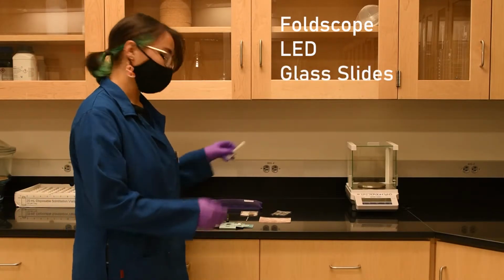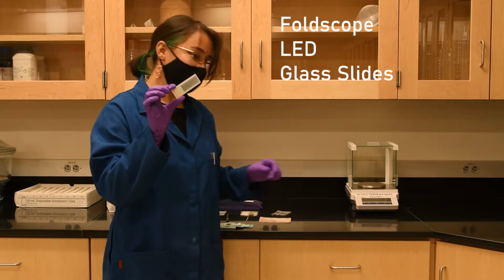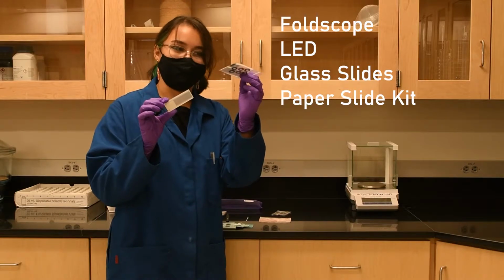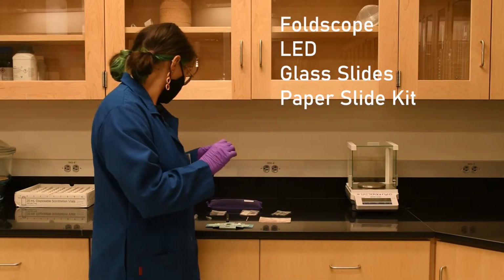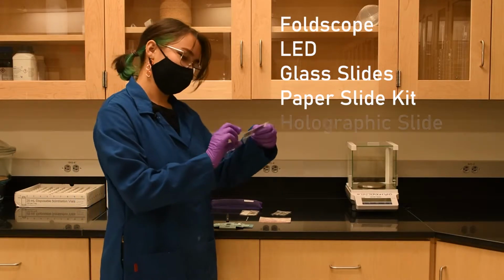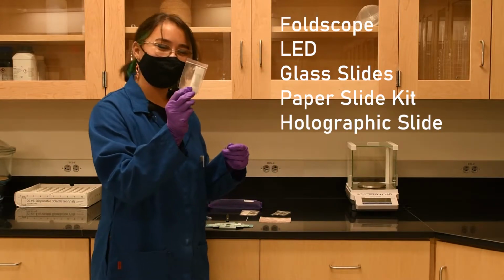Also included are two different sets of slides. Here we have the glass slides and the paper slide kit, which will include everything you need to mount your sample. In addition to those two slides, we also have the holographic slides if you want to try those out.